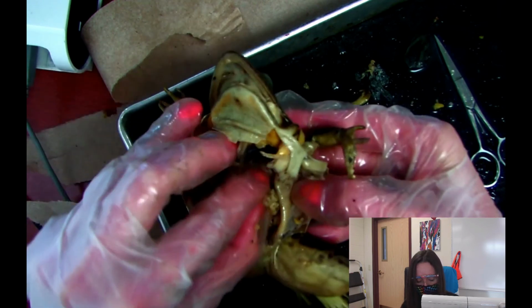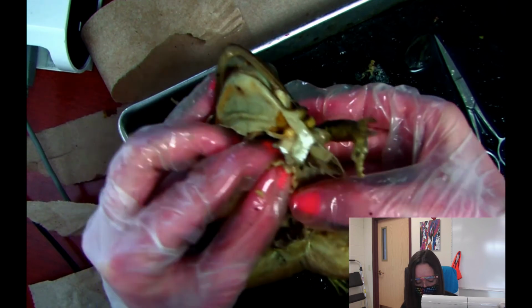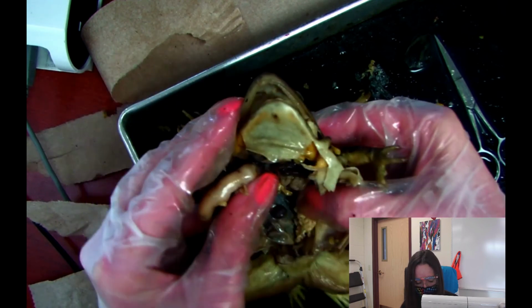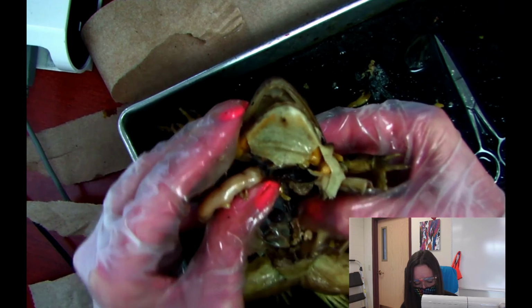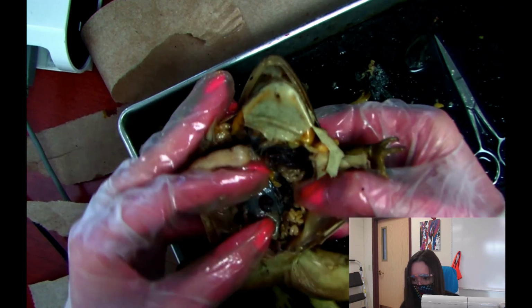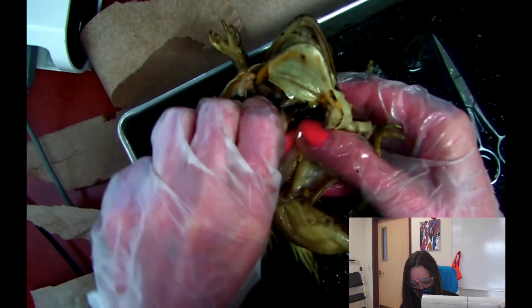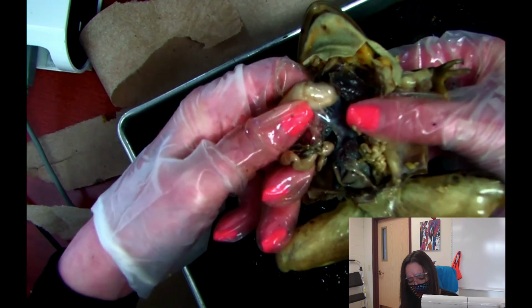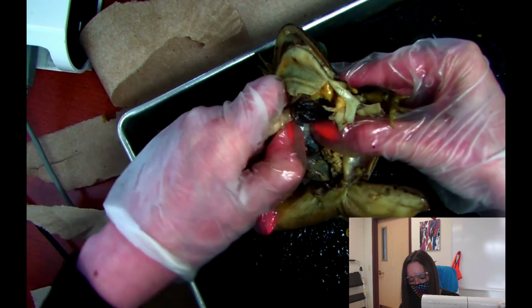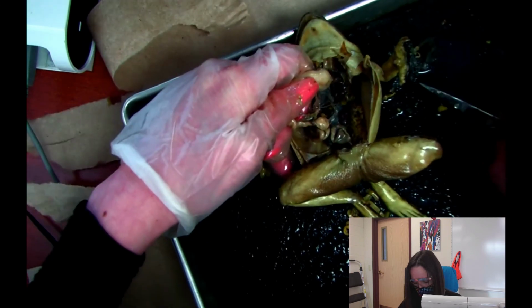You do not need to know the oviduct for the test, so I'll skip that because who knows if we'll have a male or a female. See, we weren't able to see the testes for this. So you'll probably see the testes if you're in class and you have a male. And so I'm going to go ahead and take the stomach out. And see this clear stuff? That's connective tissue. So I'm going to go ahead and take it out so that you can better see the lungs. So I'm actually probably going to cut it.